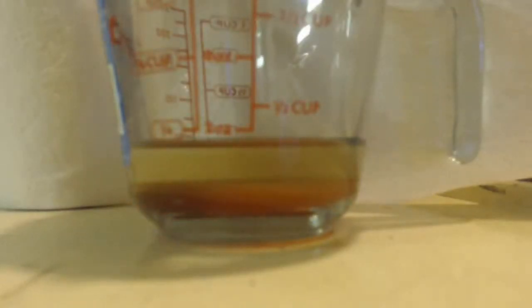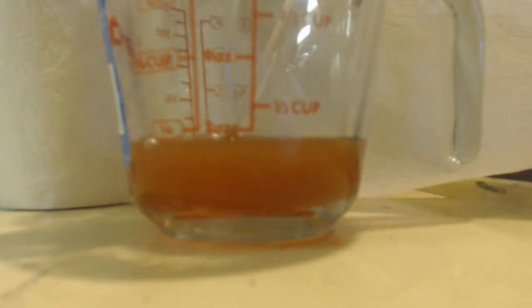You can see I got some of it with the solids in the bottom. See that? Hoping some of that's the iodine. So I'm just going to pour a little bit of acetone in there. And I might as well put it all in there, screw it. And what I want is it to go clear. Get all that brown crap out of it, all that purple stuff there. I have some 2 molar sodium hydroxide. I'm just going to put in a little bit at a time. Keep stirring it till it goes colorless.